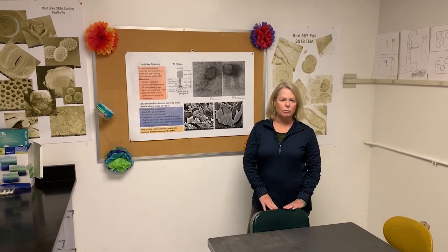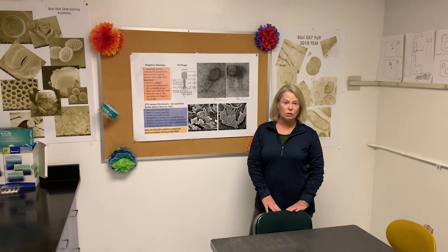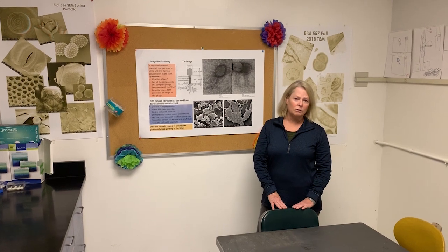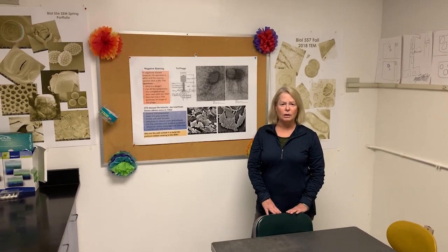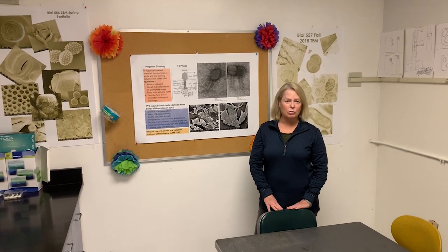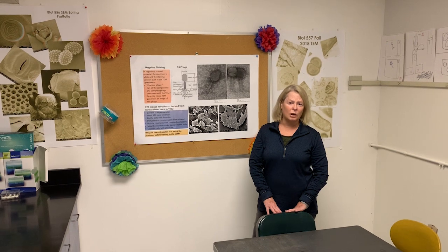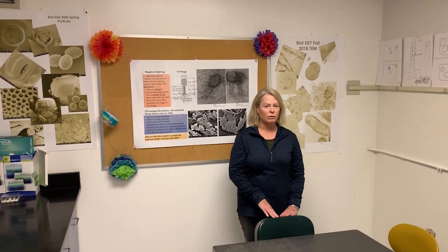I came here from UCSD, and I came here because I really like to teach, and I really enjoy teaching the TEM class, which we offer in the fall, and the SEM class, which we offer in the spring. We limit our students to 10, so it's a very personal one-on-one experience, and you get to learn how to use these marvelous instruments for yourself.